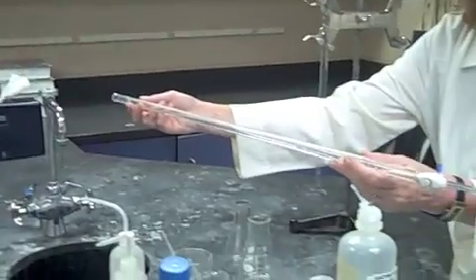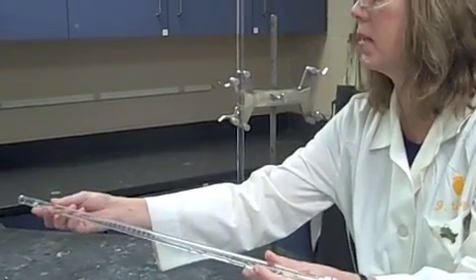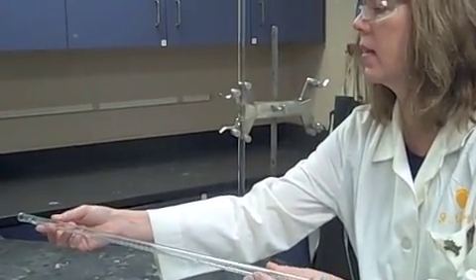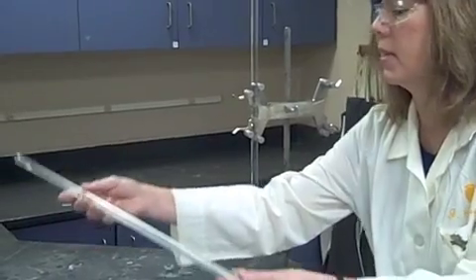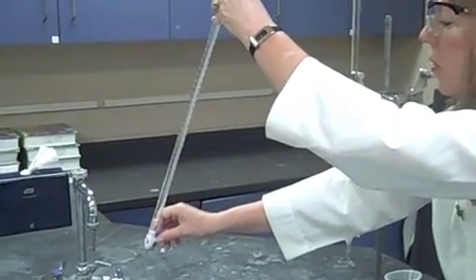Always try to hold your glass burett over the sink, because there are times when you're coating the sides like this that you might have some spill over, and you don't want to be spilling it on your feet or on your neighbor.